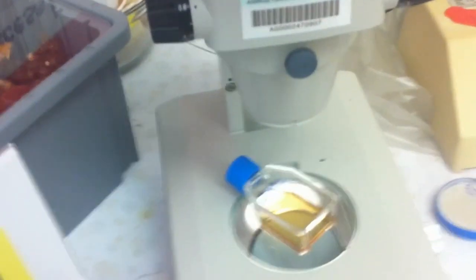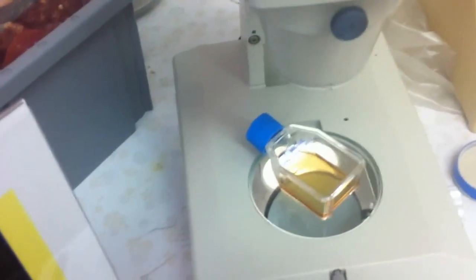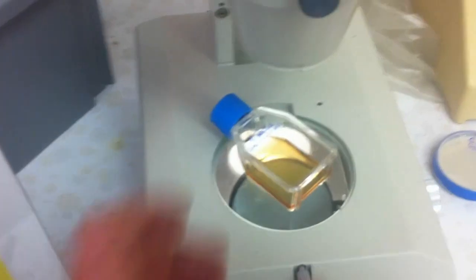And this is actually what they refer to as a beer nematode because they like yeast. It's all pre-labeled, but you're going to be able to see when they look into the dissecting scope, they're going to see the nematodes swarming around very vigorously. The ones that are still are actually the dead adults, and ask them to look at the size differences and so forth.